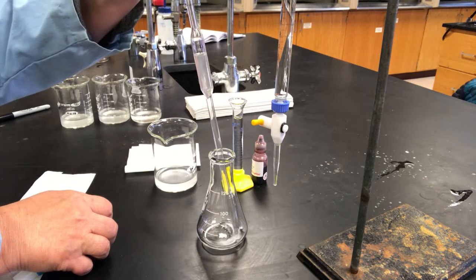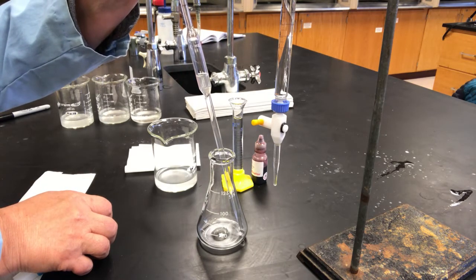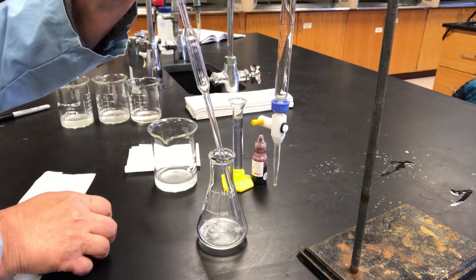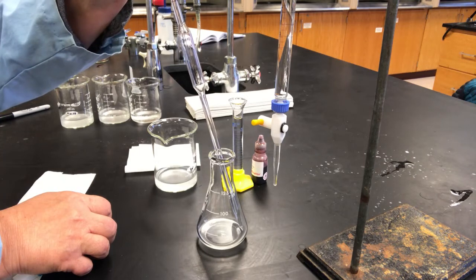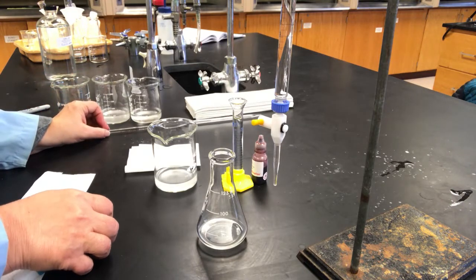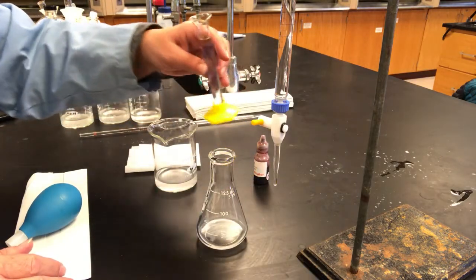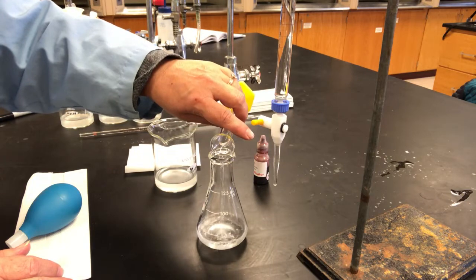the Erlenmeyer flask. So remember, when we quantify, we're going to be quantifying the total hydroxide. Now this is the water. Since the only source of hydroxide was the calcium hydroxide, this will correspond to the hydroxide that was provided by the calcium hydroxide, or the equilibrium calcium hydroxide that you see in the data table. All right, now we have to add some additional water so that we can see our endpoint. Now we're titrating with hydrochloric acid.